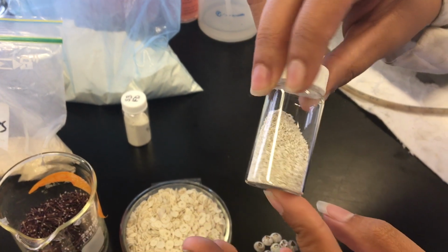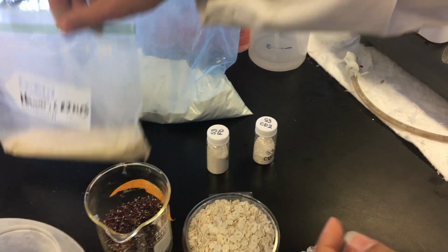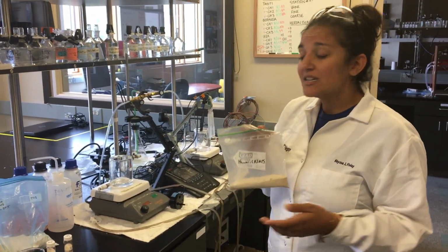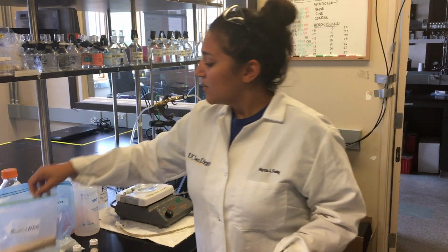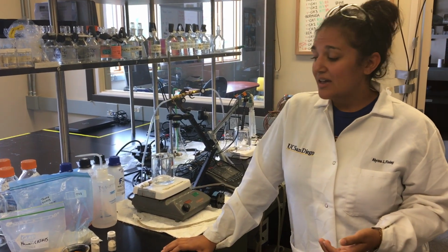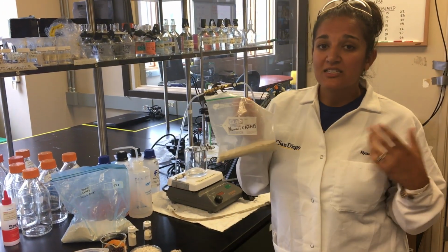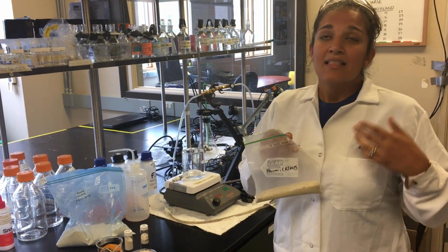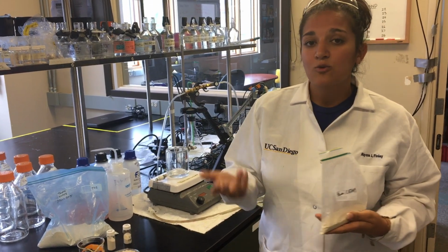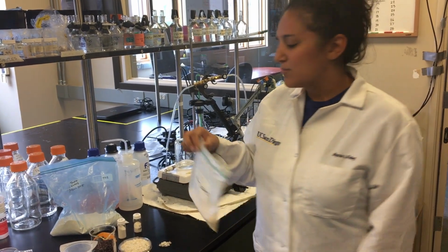So here we have a bunch of different samples of what we call calcium carbonate sand, which is just after these animals die, they get broken down into different sands. And in different areas of the world, different organisms make up this sand. And what we're interested in is looking at how ocean acidification is going to influence the sand, because as the ocean gets more and more acidic, it can actually react with the sand and make it dissolve. So one way to think about that is like putting vinegar on baking soda. So basically it starts to dissolve all this sand, and then all of these organisms like corals and sea urchins, they don't have a good foundation to live on anymore.